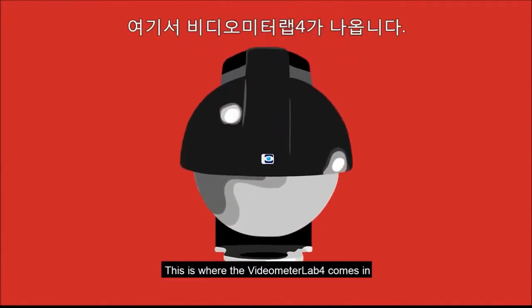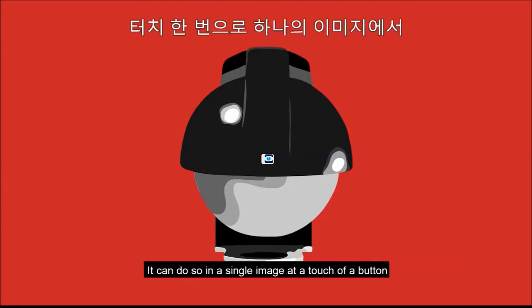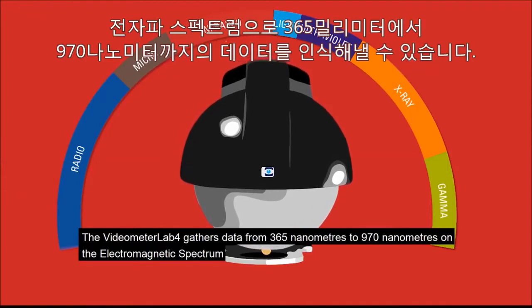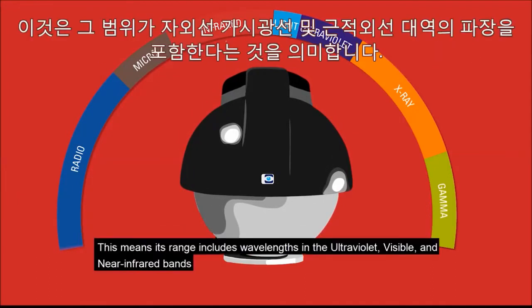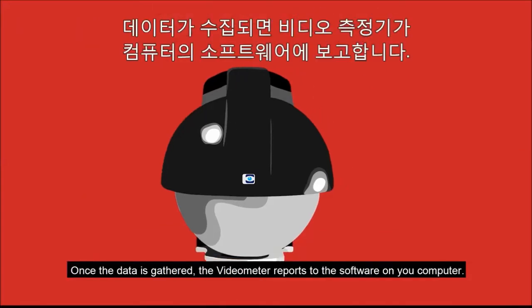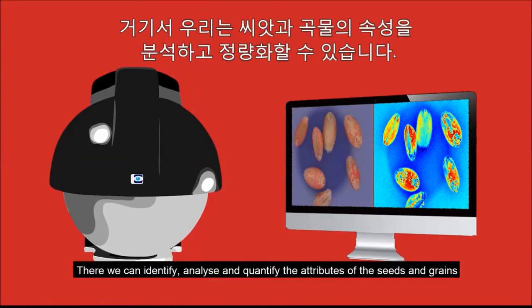This is where the Videometer Lab 4 comes in. Not only can it detect, measure and highlight all of the previously mentioned attributes, it can do so in a single image at a touch of a button. The Videometer Lab 4 gathers data from 365nm to 970nm on the electromagnetic spectrum. This means its range includes wavelengths in the ultraviolet, visible and near-infrared bands. Once the data is gathered, the Videometer reports to the software on your computer. There we can identify, analyse and quantify the attributes of the seeds and grains.